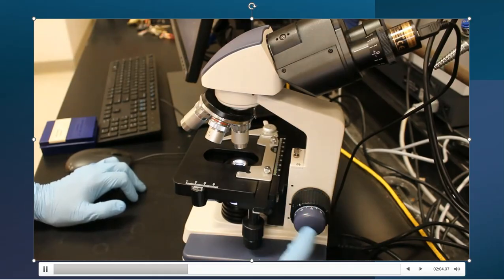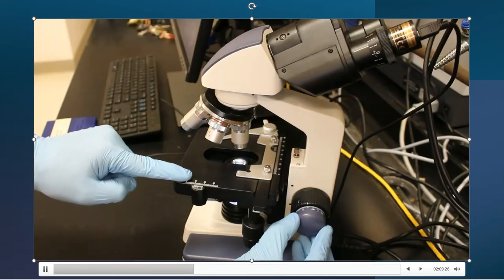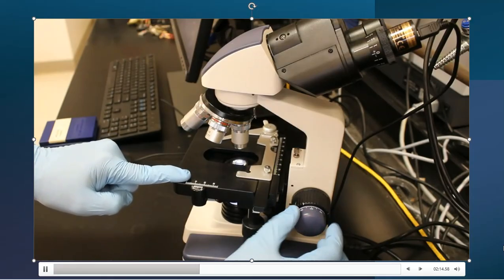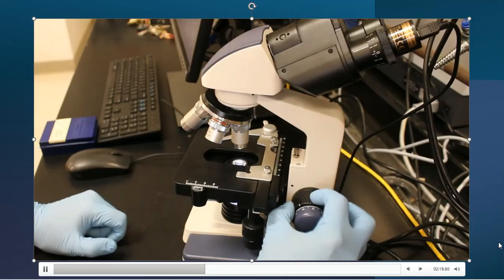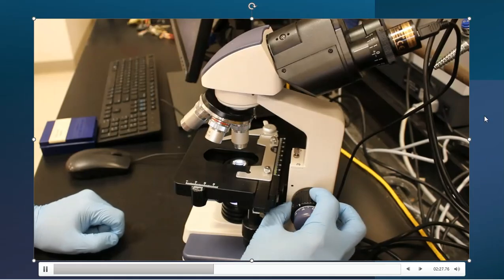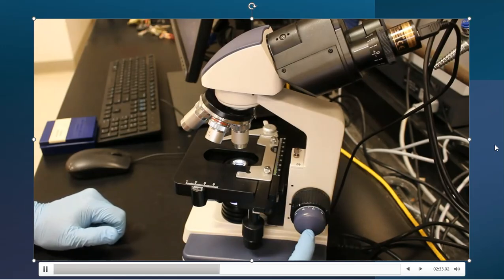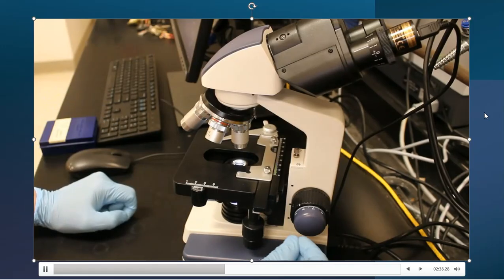This blue knob in front is actually a different dial, and this is a fine tune. So you're actually seeing this also is moving it up and down, but very gradually. It is very sensitive. It does little bitty baby steps at a time. So this is the major adjustment, and that is the minor adjustment there. Often what happens is that we work with the big knob first, and we get it to a point where we think we can see the samples under the microscope, and then we shift over to the minor adjustment, and we will fine tune that microscope into that image to clear it up a little bit better.